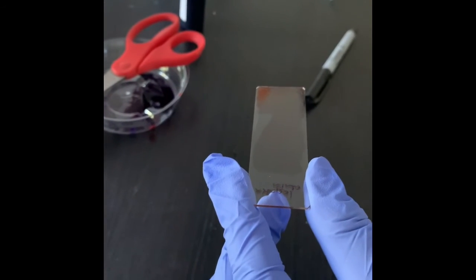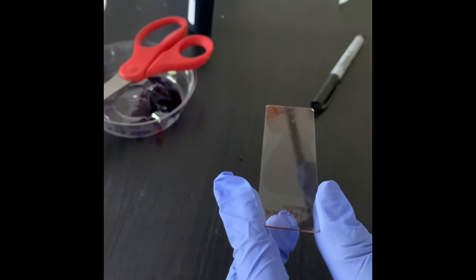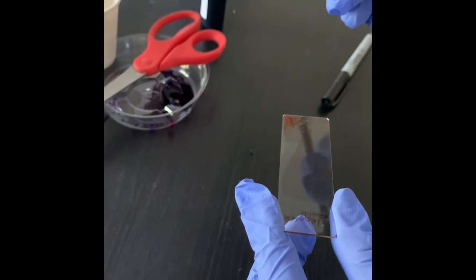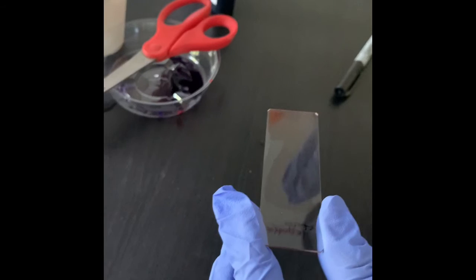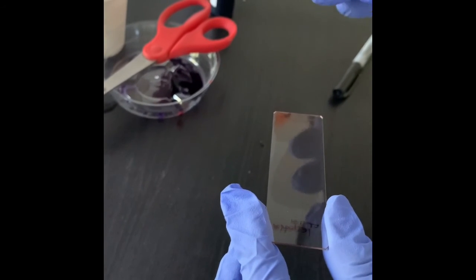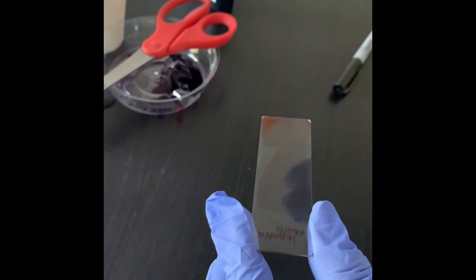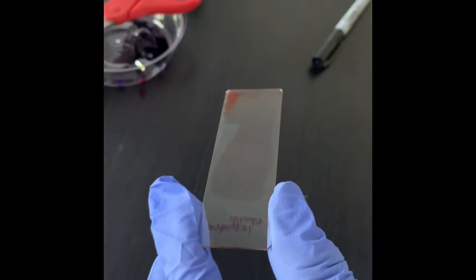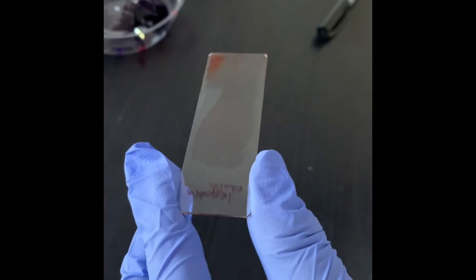We can also see the arrangement, whether two round cells are together as diplococcus, whether two rod cells are together, whether they are in a chain or in a bunch of grapes. We can see various types of arrangements. So the purpose of indirect stain is to study the morphology of the bacterial cells.